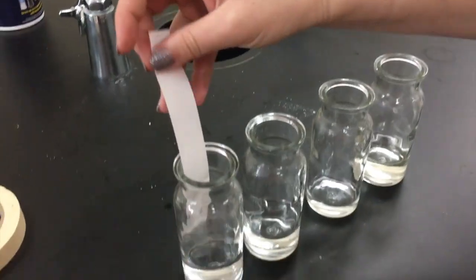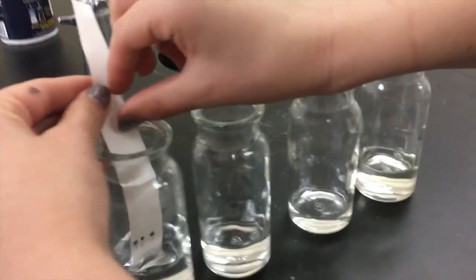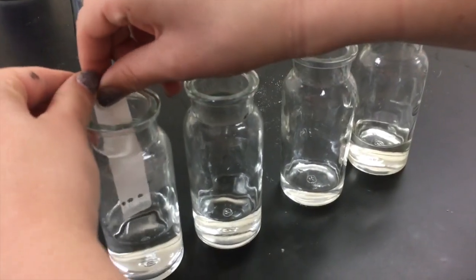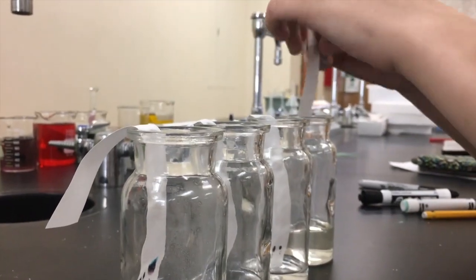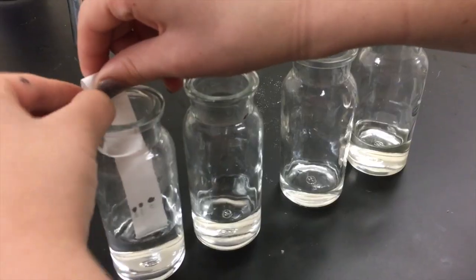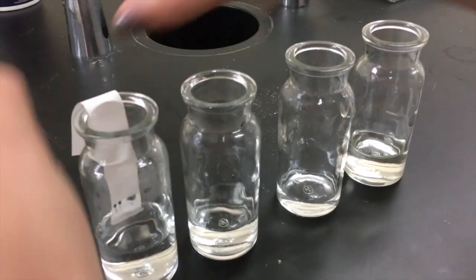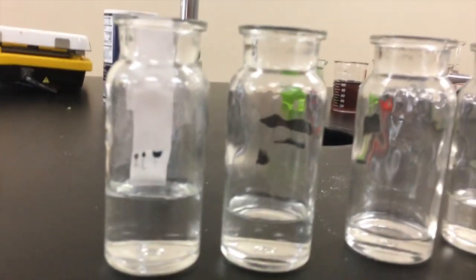Now all we're going to do is just place the strips in the solutions. So you want the bottom of the strip to be touching or submerged into the solution, but not the dots. Just make sure that the dots aren't in the solution and you'll be good to go.